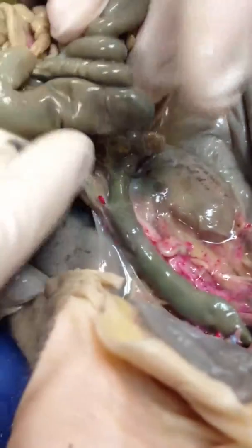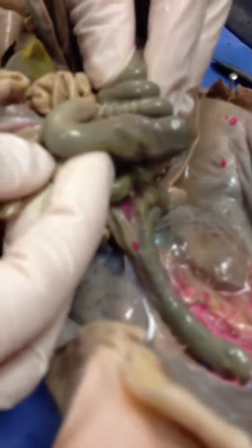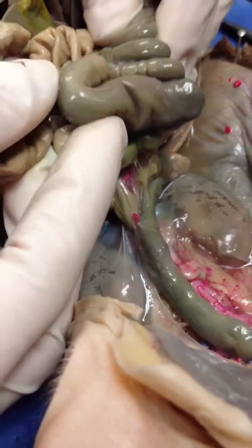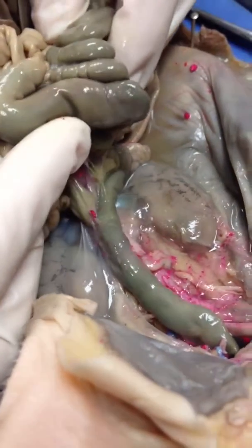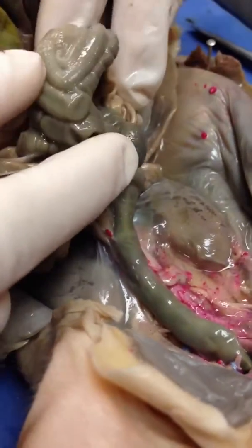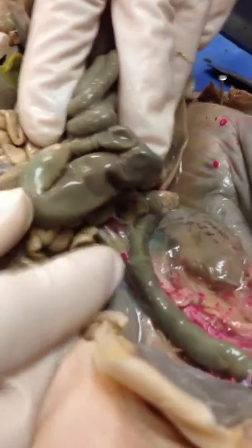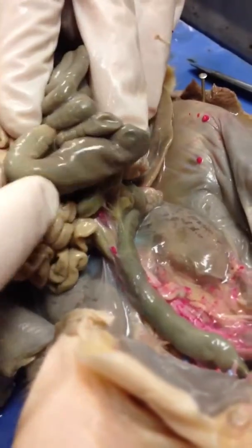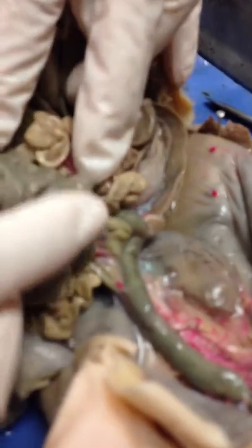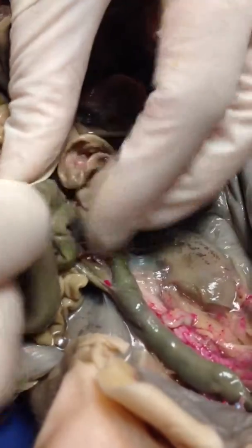So the entrance to the large intestine is the cecum. The cecum is right here, and it looks like a finger. Is there an appendix there you can see? Pigs don't have an appendix, so only the cecum. And then from the cecum, we have the rest of the large intestine. Again, don't worry about identifying the different regions for the large intestine. Would we have to know the cecum? Yes. So that could be one of the structures. There could be a little pin sticking in the cecum. Hint, hint, possibly.